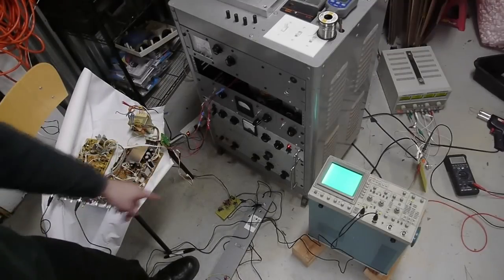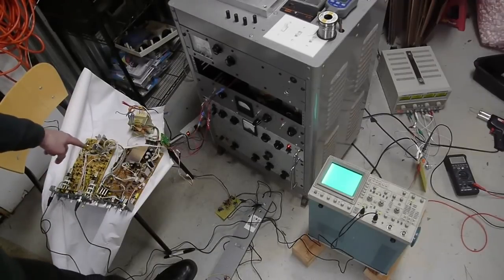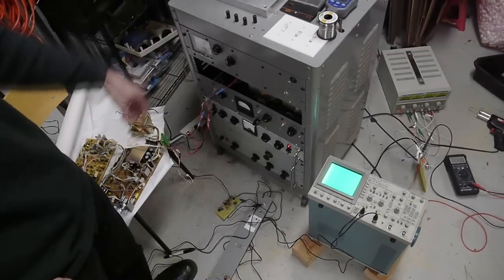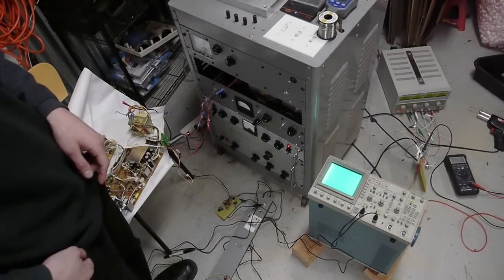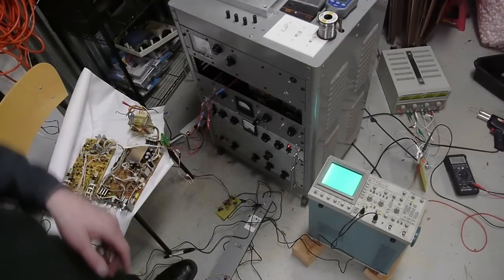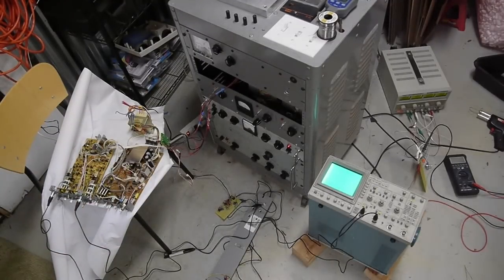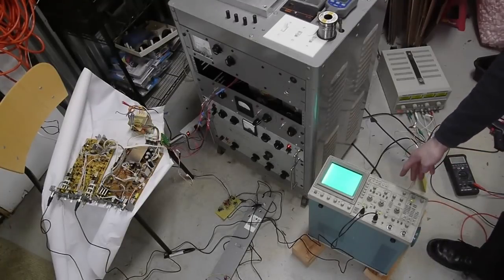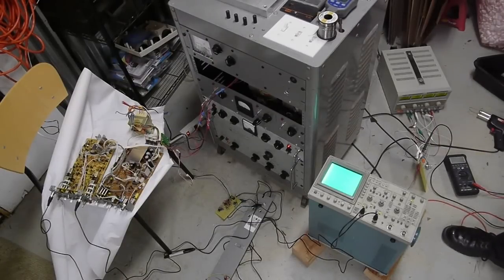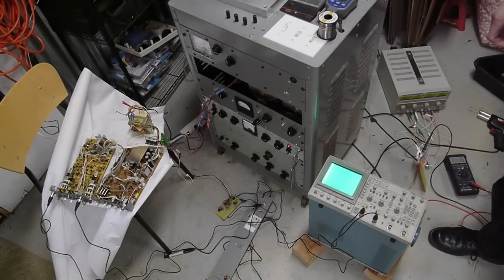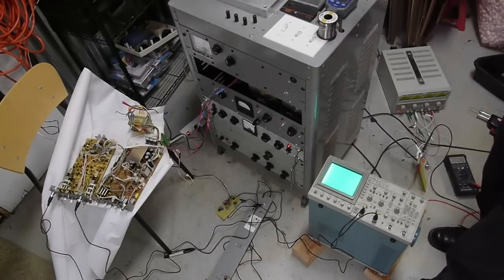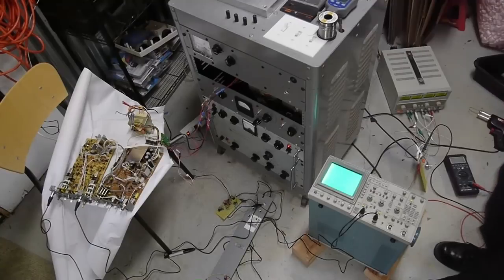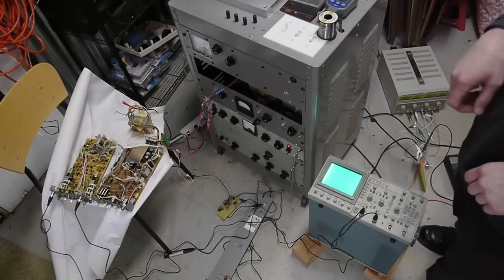The signal is split off from that function generator and sent through this amplifier that runs the scan circuitry for the electron microscope. You should check out some of my other videos concerning the microscope for more details with that. The Z-axis of the oscilloscope, which this has on the back of the device, is connected to this simple op-amp circuit that amplifies the video signal from the microscope. The brightness on the oscilloscope screen is tied to the secondary electron signal from the microscope.